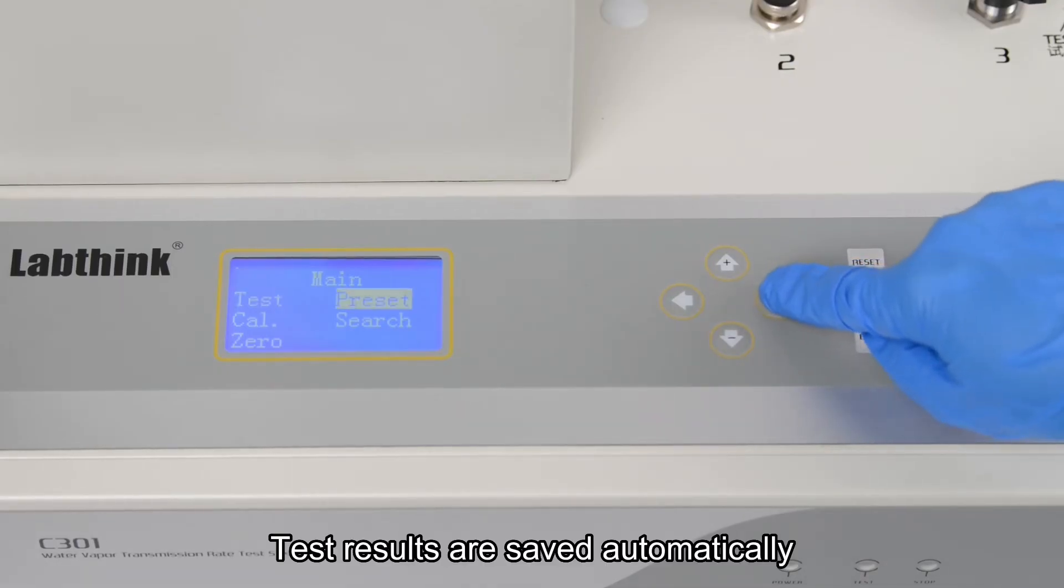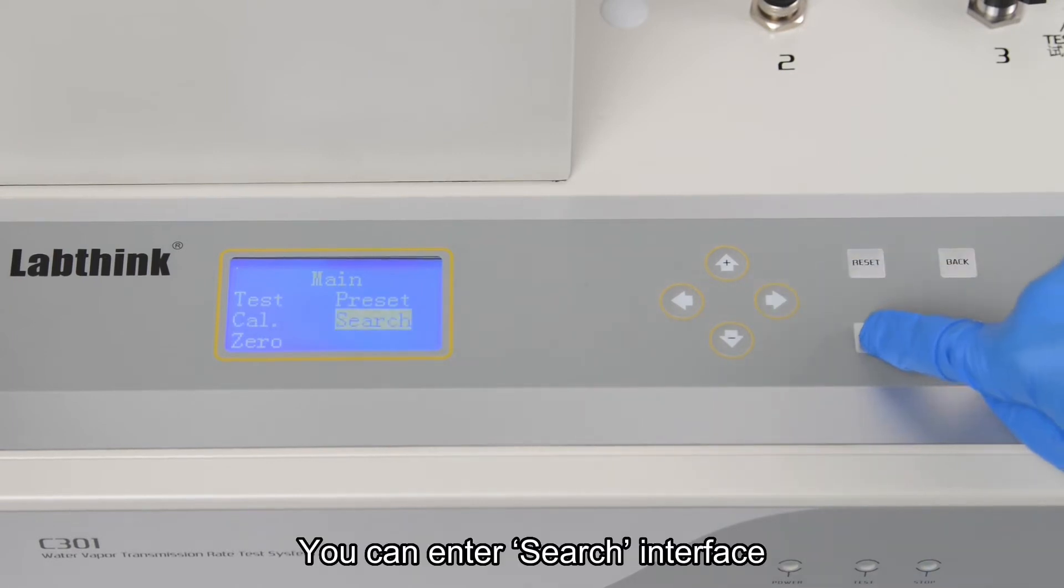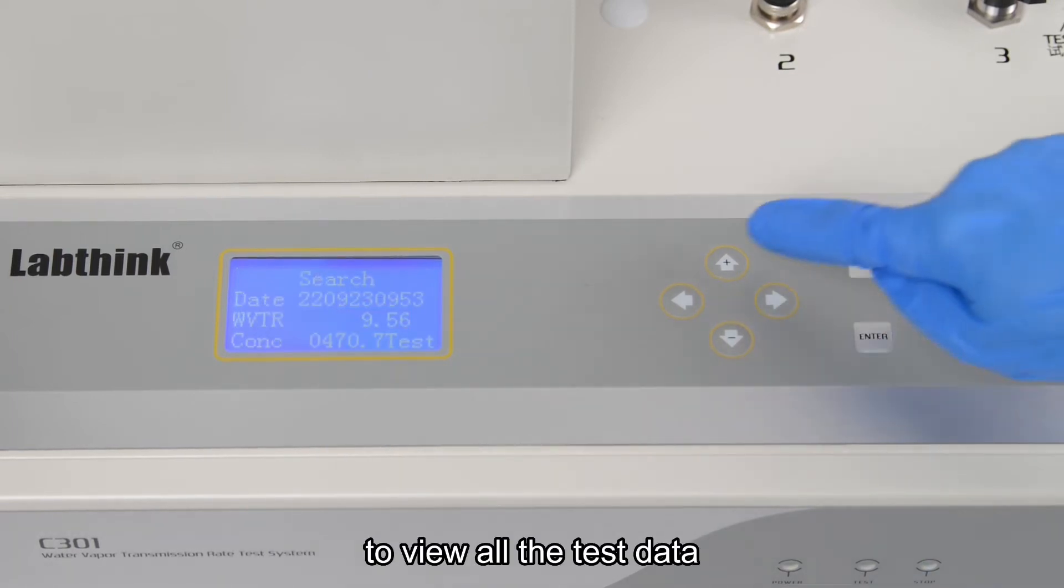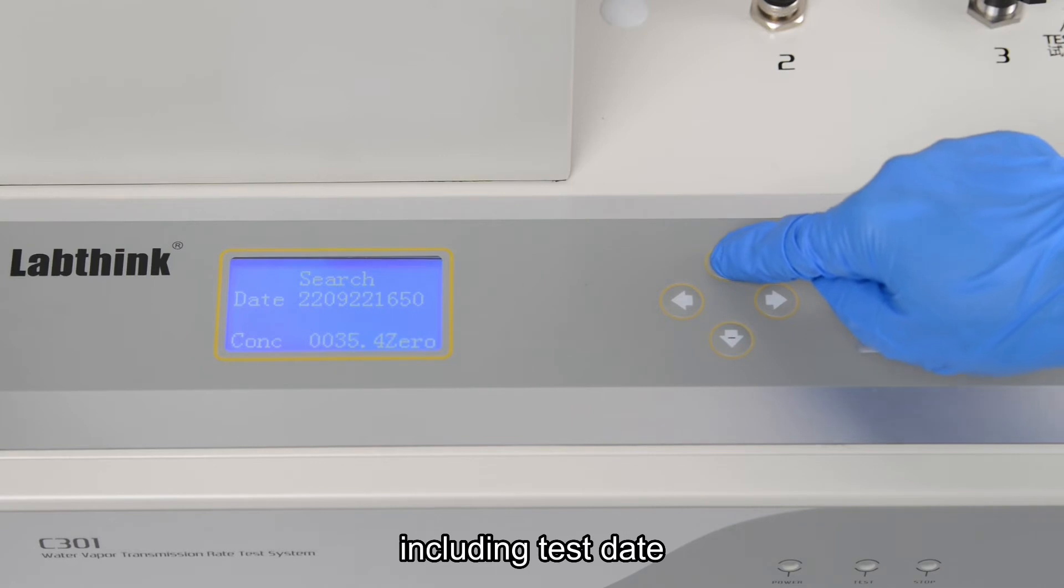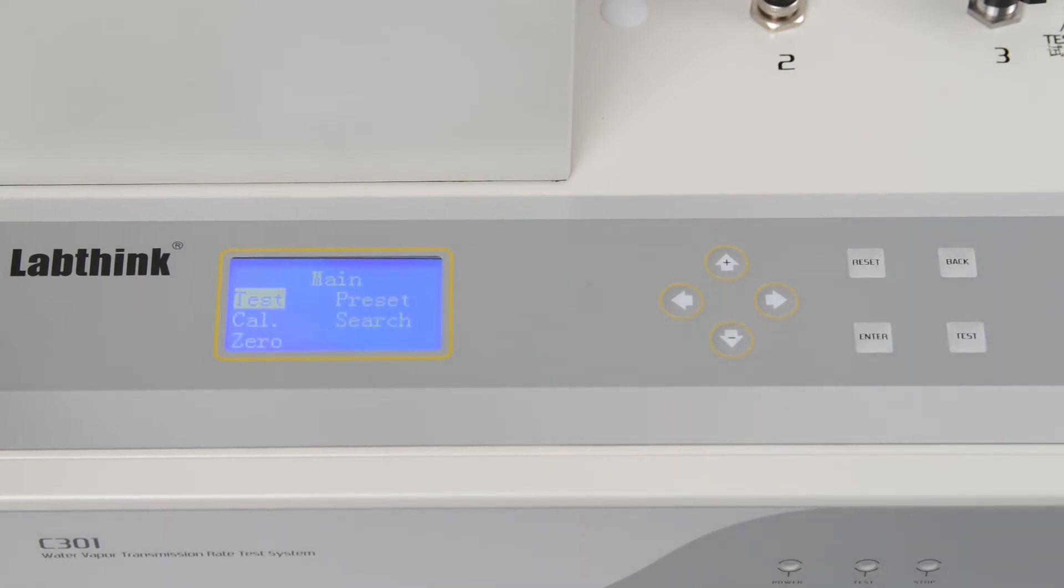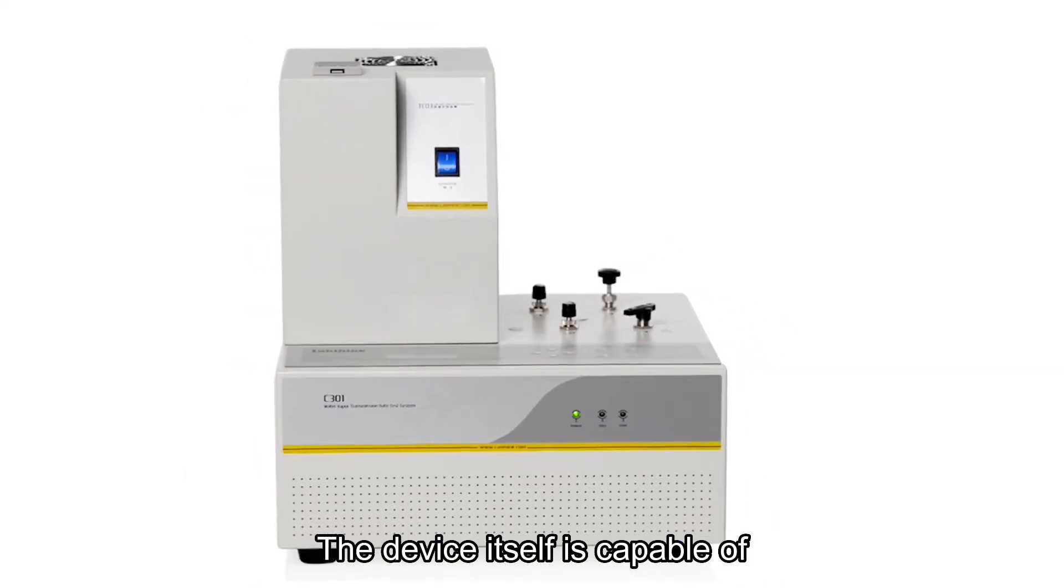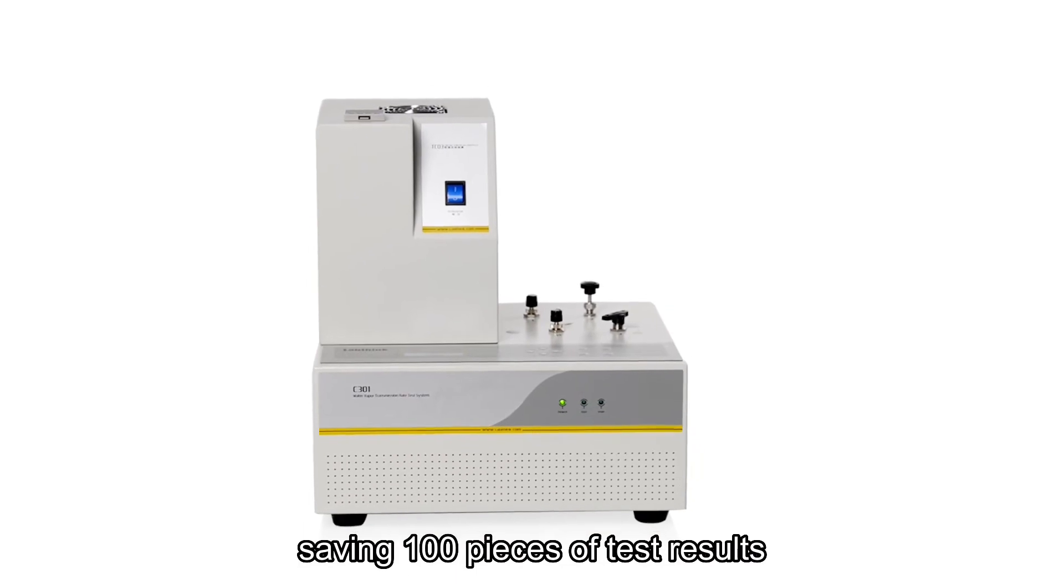Test results are saved automatically. You can enter a search interface to view all the test data, including test date, WVTR, and gas concentration. The device itself is capable of saving 100 pieces of test results.